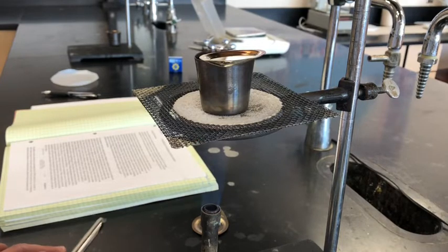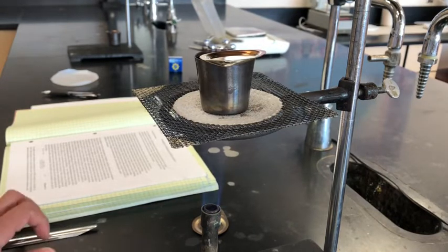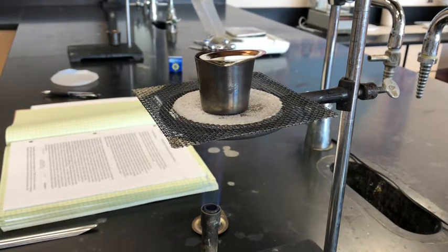So what this is going to allow us to do is to be able to determine out of the original 2 grams of sodium bicarbonate, how much sodium carbonate we can produce. So of course the mass of the product is going to be less than the mass of the reactants because the lid is partly open here, and so we're letting the gases escape. So we want to be able to calculate the percent of the mass that is conserved in this chemical reaction. So let's let it go for 2 minutes.